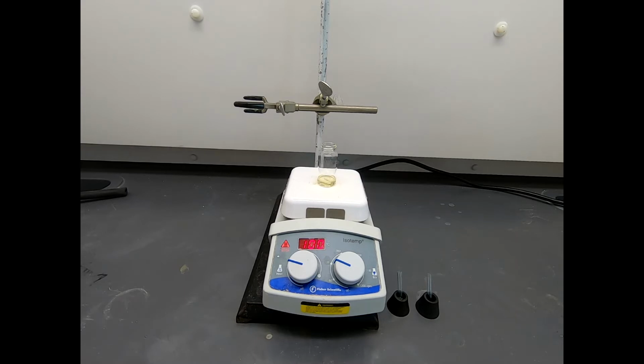Now, according to the procedure, this reaction is supposed to heat on a steam bath. So this is from an older reference. And steam baths were a very common way that people would heat things, 75 years ago. So now I'm using a hot plate. I set the hot plate to 100 because that's about where steam is. But the procedure is very explicit. Don't heat it for longer than 20 minutes, and don't heat it excessively. Don't heat it a lot more than you get off a steam bath. So really, this reaction's run its course.